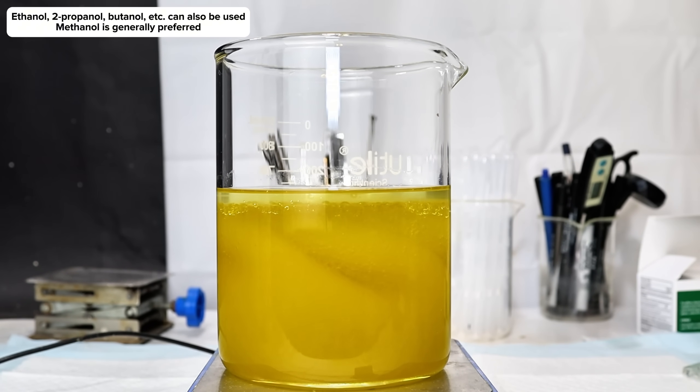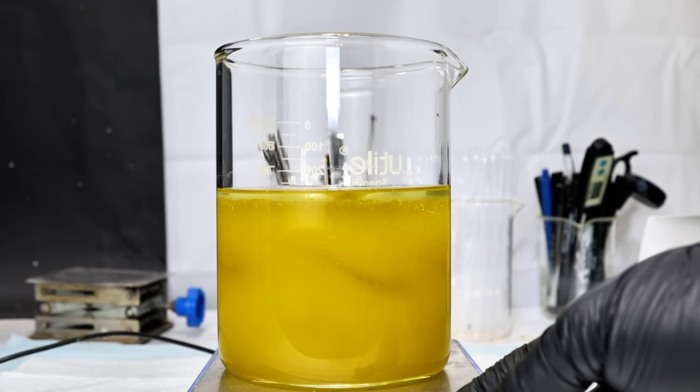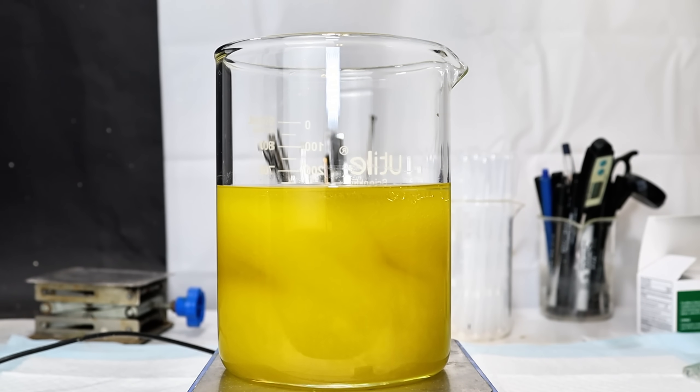Given that they're both fairly non-polar, the methanol will dissolve to some extent in the oil. They aren't entirely miscible though, so for the most part this simply results in an emulsion of methanol and oil, which in my case turned a light yellow.